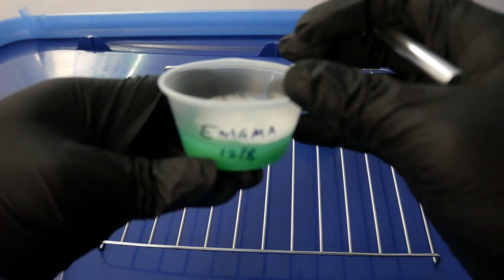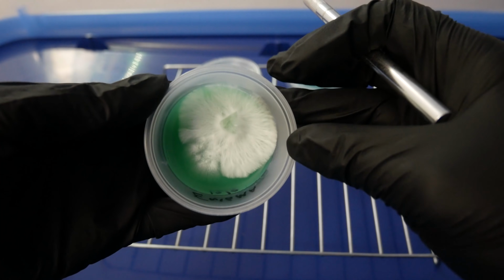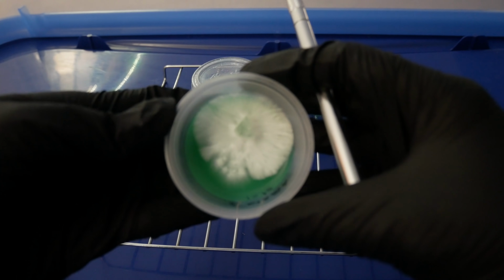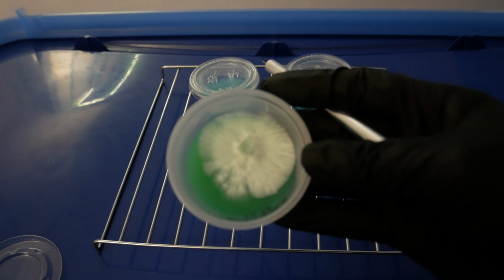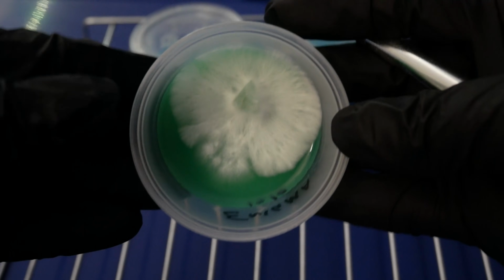All right, here's the clean looking plate. Here we'll take a look. You can see the mycelium is starting to form some rhizomorphic growth on the edges. You can see a couple sectors out of here. Here we'll zoom in so you can see.